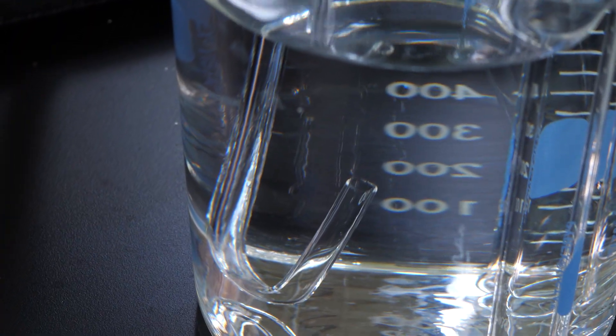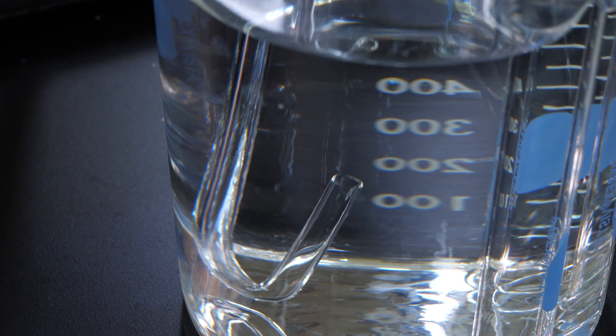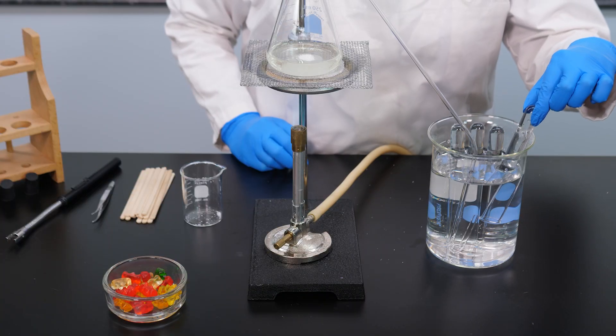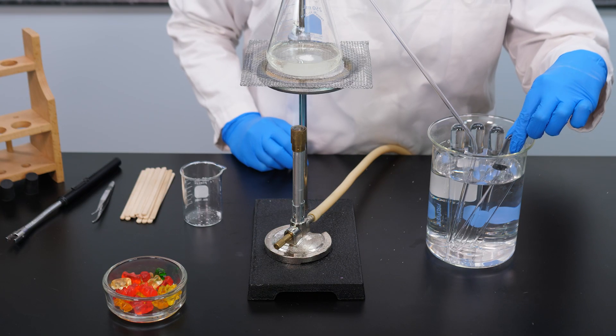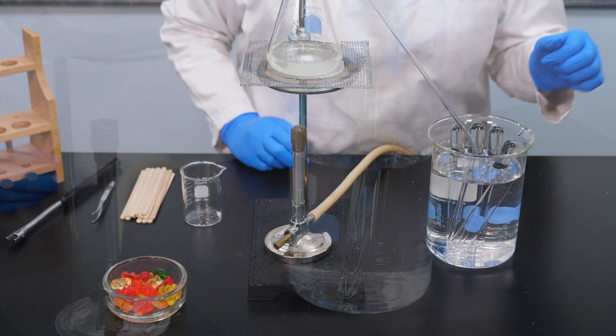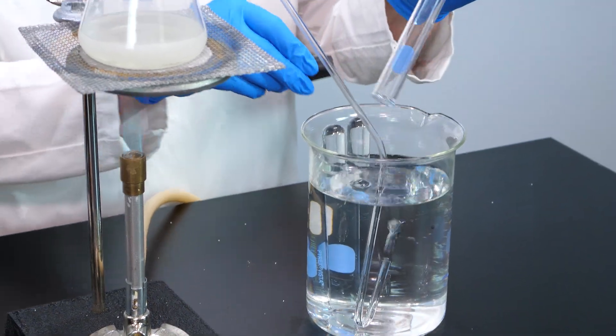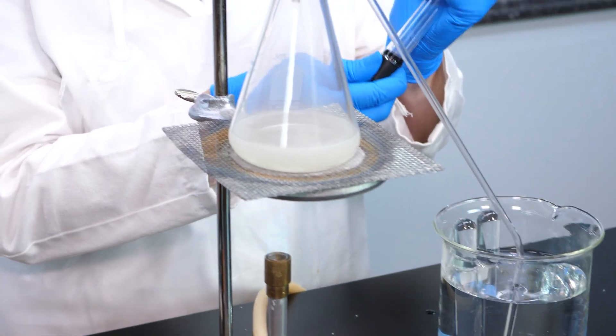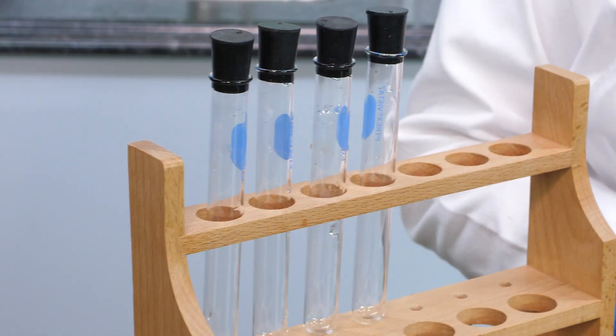Notice the oxygen bubbling into the water. We will collect some oxygen gas in test tubes by water displacement, similar to the procedure we followed to collect hydrogen gas. Now that we have collected some oxygen, let's examine its properties.